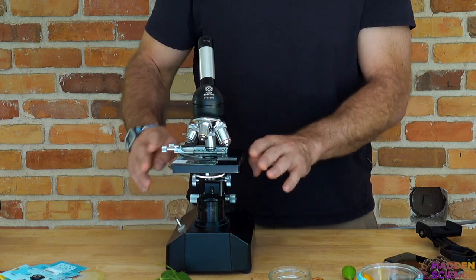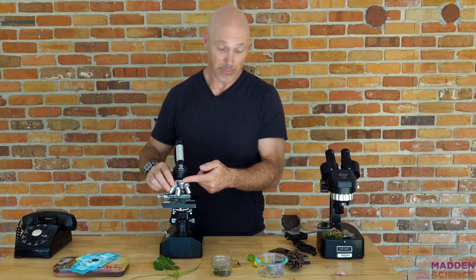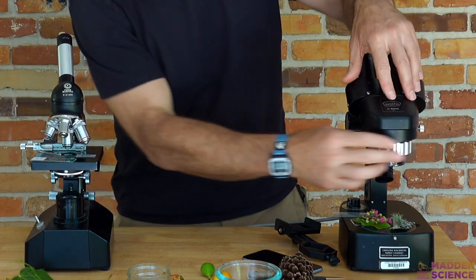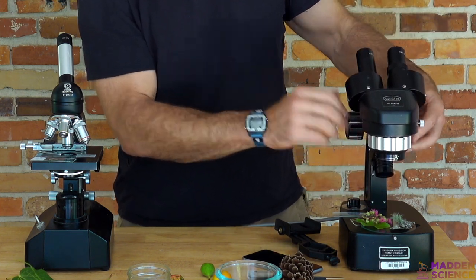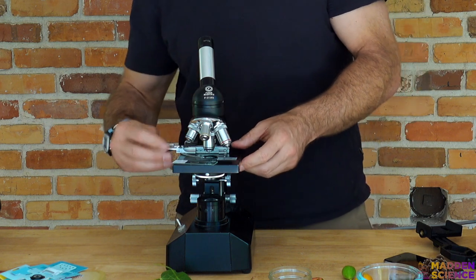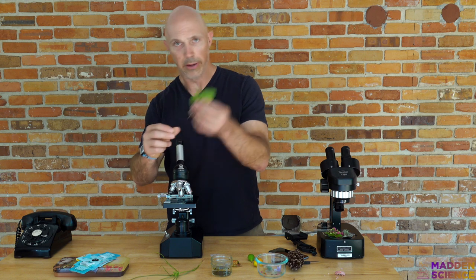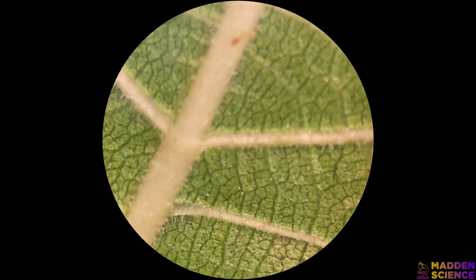You have a base and a stage. You're going to want to start with your stage all the way down. You've got maybe one, two, three, or in this case four different objective lenses — you can see and hear them click into spot. In the case of the dissecting scope, you can change your magnification and your focus right here. In this case, the actual lenses move; in the other case, the stage moves. You can see this one also has clamps to fasten the slide. I just put a tick on a piece of tape — you could put the specimen directly on there if it's thin enough. I can put that here and look and see how beautiful that is.